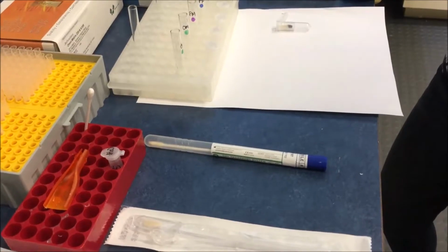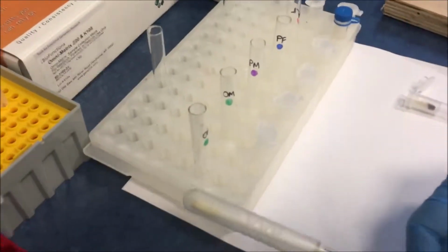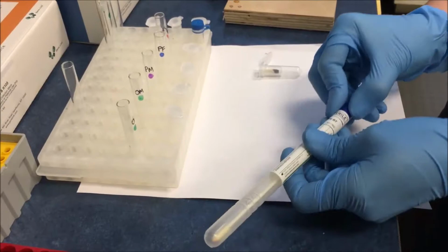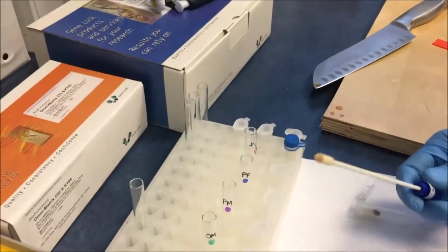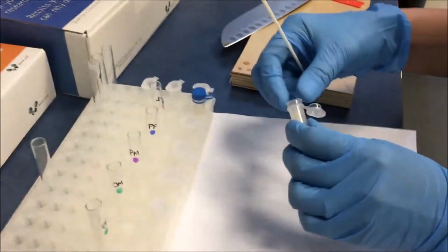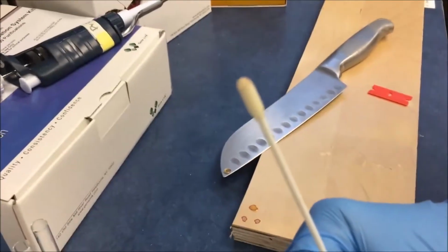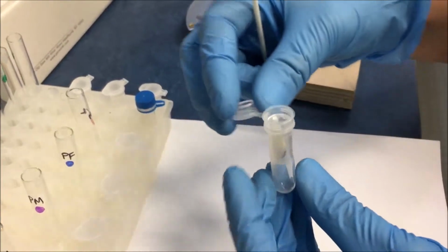This is session 3, and the sample in the collection tube, in terms of swab or any of our Omni-Matrix, have arrived in the lab. In the lab, they open the container, and normally with the swab, the front portion is cut off and inserted into a spin basket. So this is just the front portion of the swab which is cut off and inserted into a spin basket with a tube.